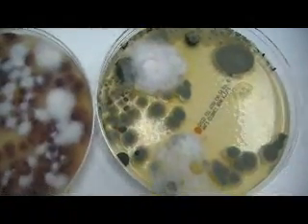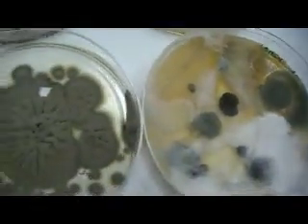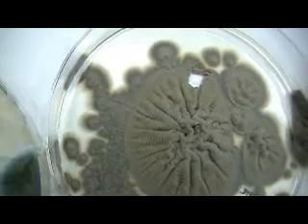The color of the mold is mainly determined by the color of the spores, or sometimes by the byproducts that the mold produces. What we are seeing now are actually spores, which would eventually become airborne if these petri dishes or these cultures are left open.